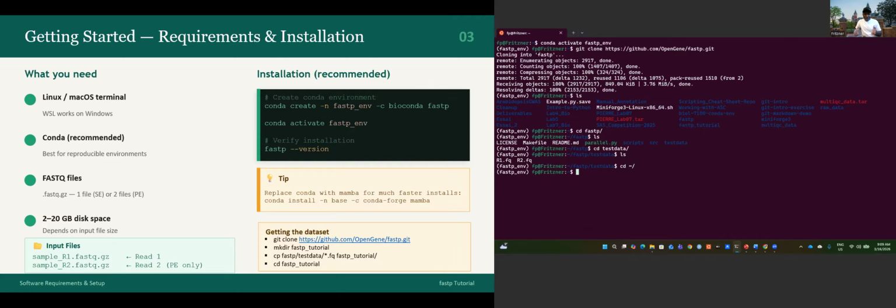Now that we confirm we have downloaded the data from GitHub, we need a directory for this project. Let's make our directory with mkdir. I will put the -p flag because if the directory already exists, it will silently do nothing, and if it doesn't exist, it will create it for you. Let's call this directory fastp_tutorial. Okay, let's move inside this directory.